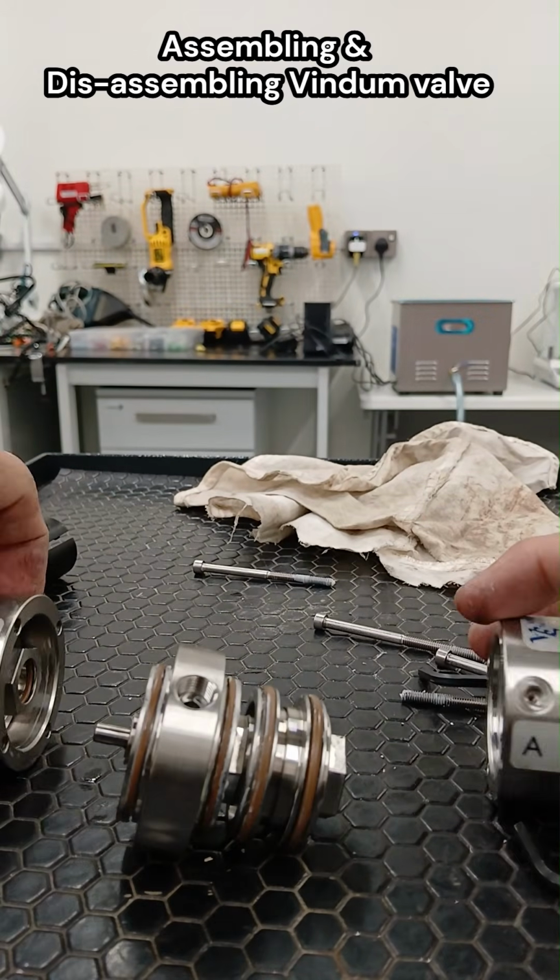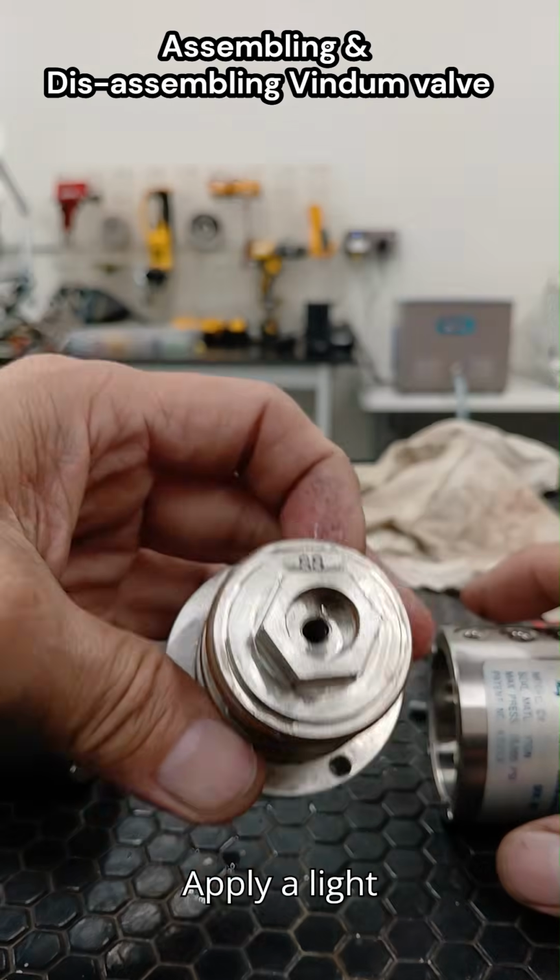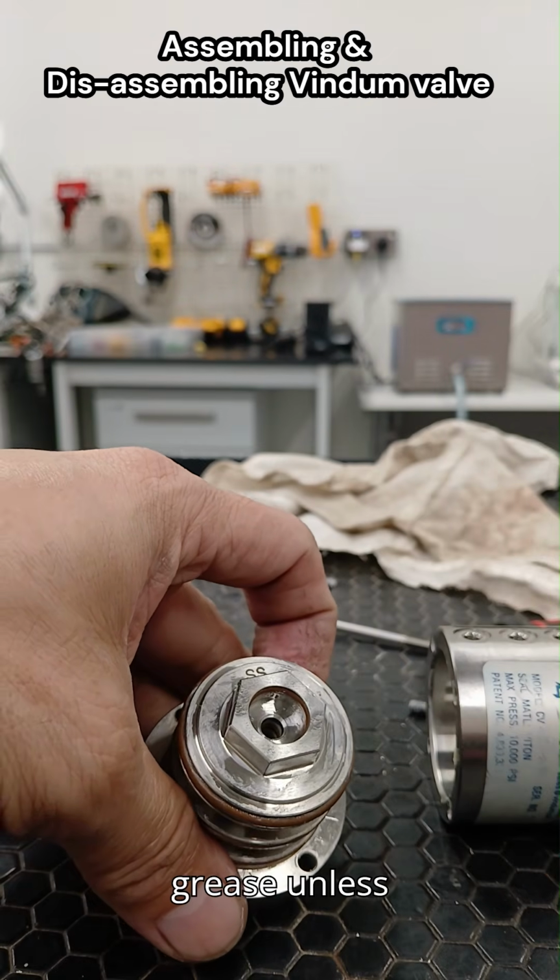Four, seal replacement. Install new O-rings and seals from the repair kit. Apply a light coat of manufacturer-approved lubricant. Never use petroleum grease unless specified.